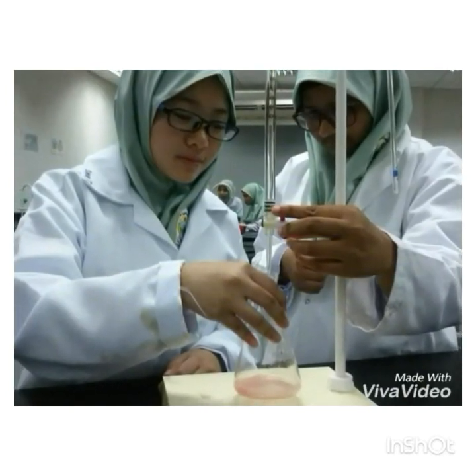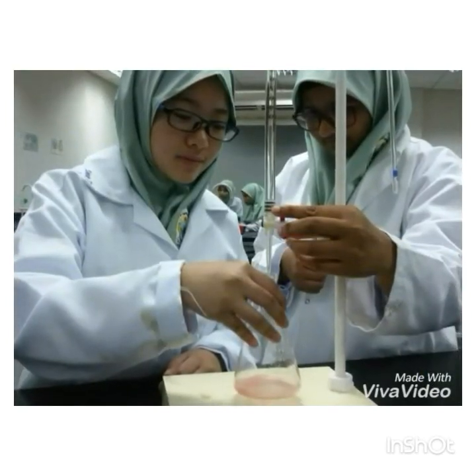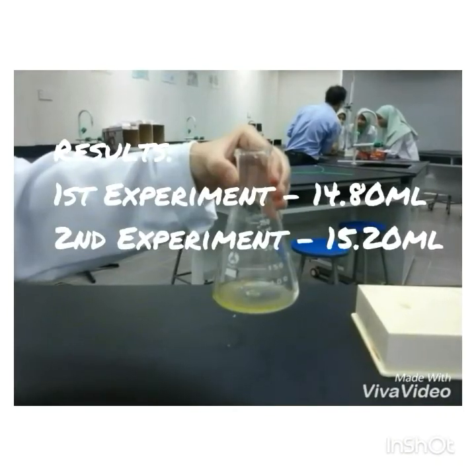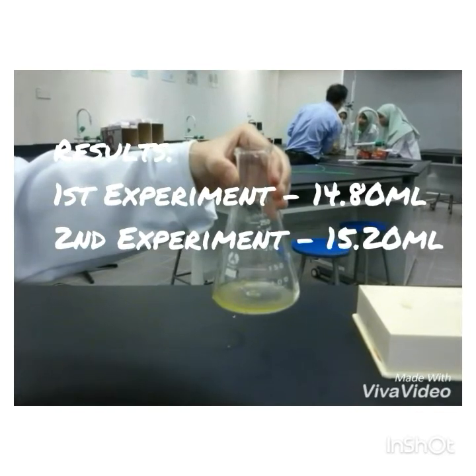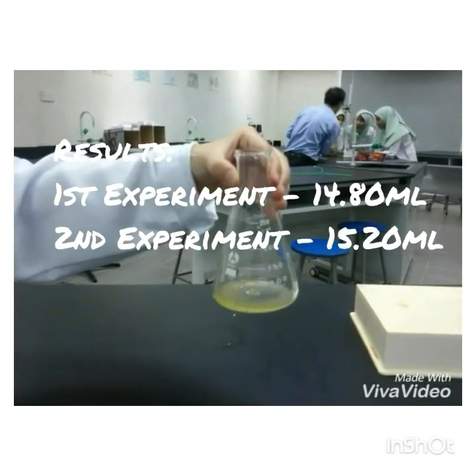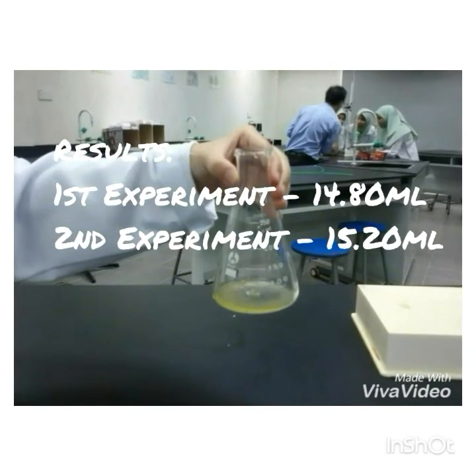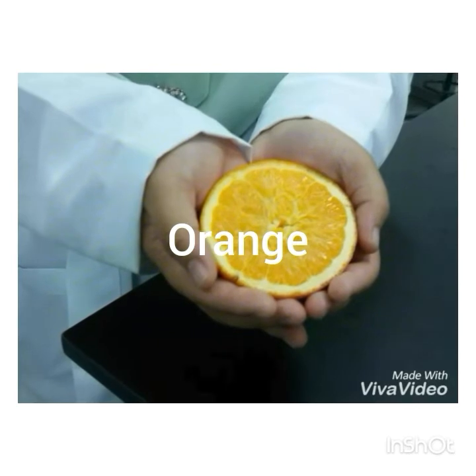We started to add the sodium hydroxide into the lemon juice drop by drop until it turns into a yellowish color. The reading for the first time of the lemon with the sodium hydroxide is 14.80 milliliters. And for the second time, we got 15.20 milliliters.